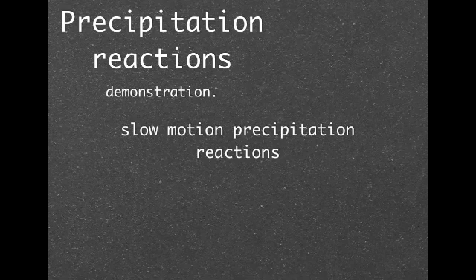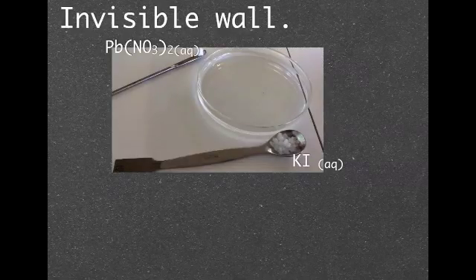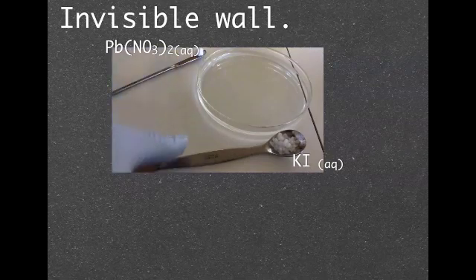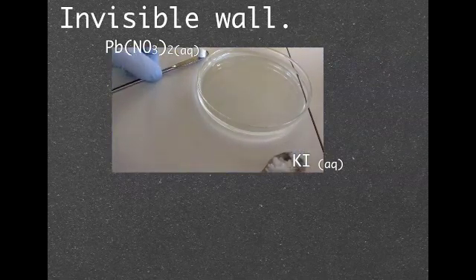dissolving and forming precipitates. So let's have a look at how it looks. The idea is to try and use this information and write a full chemical equation and an ionic equation while you're watching this video.